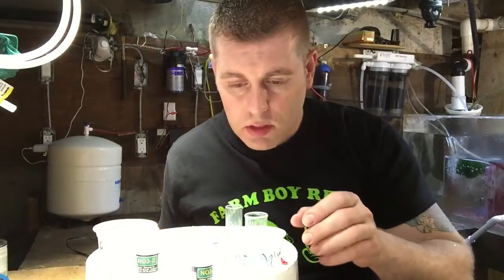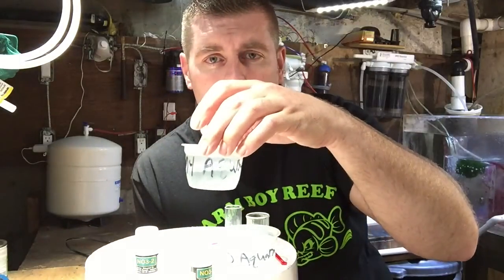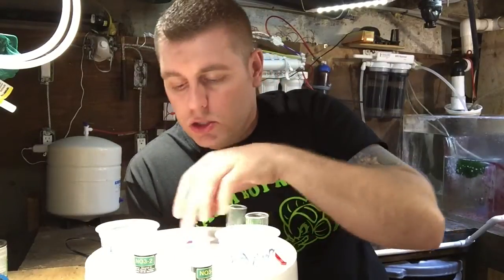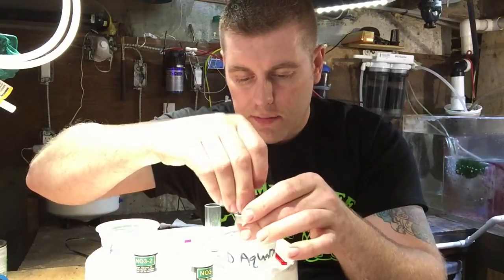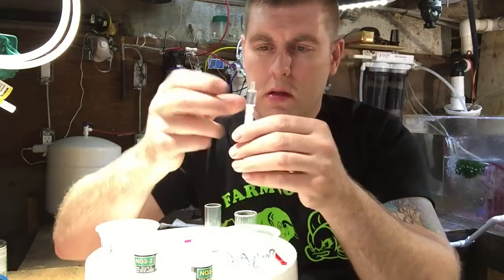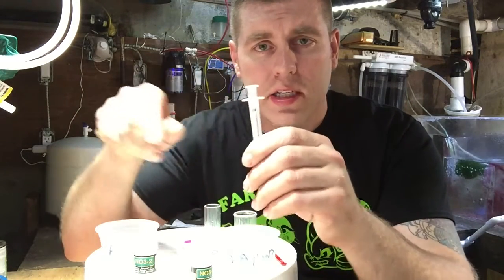I'm going to put the chart to the side for now. For this testing, I saved some old aquarium water to show you how the test works against the chart, and I have my reef tank water right out of the sump. I'm doing two at the same time to show the difference in colors. First, take your syringe and fill it to the one milliliter mark — this one is old tank water. Fill up to one milliliter and put it in the vial.